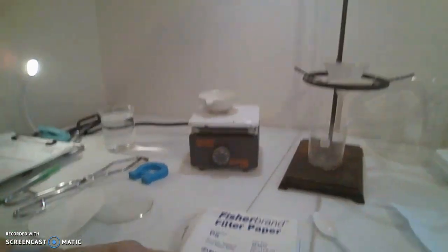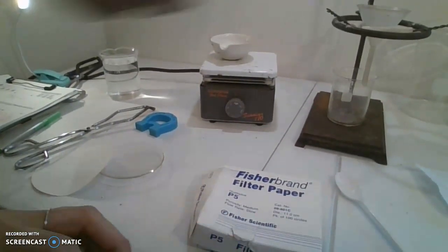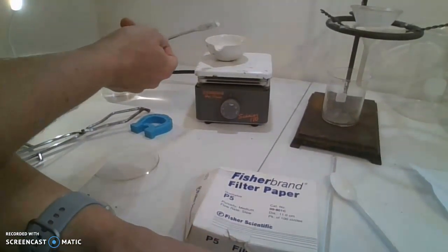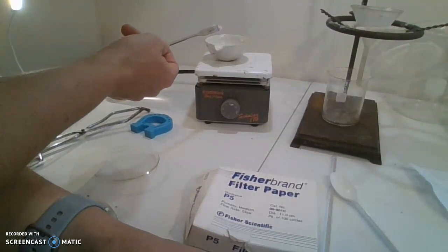The difference between this salt and the salt you get at the market is that this one is not granular, so it's not in a big block. That's all we have.